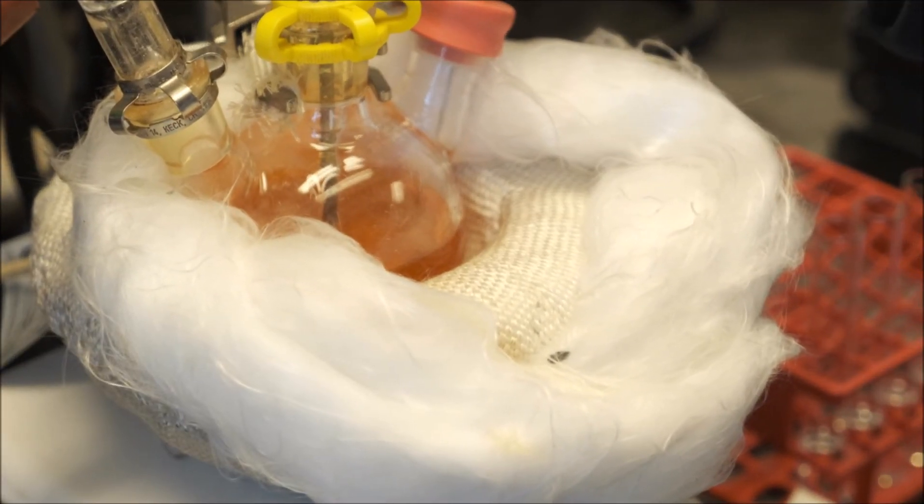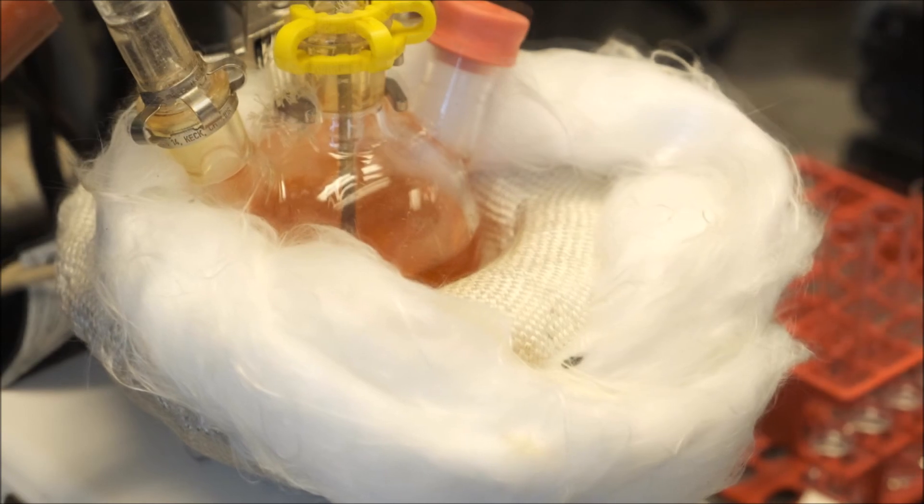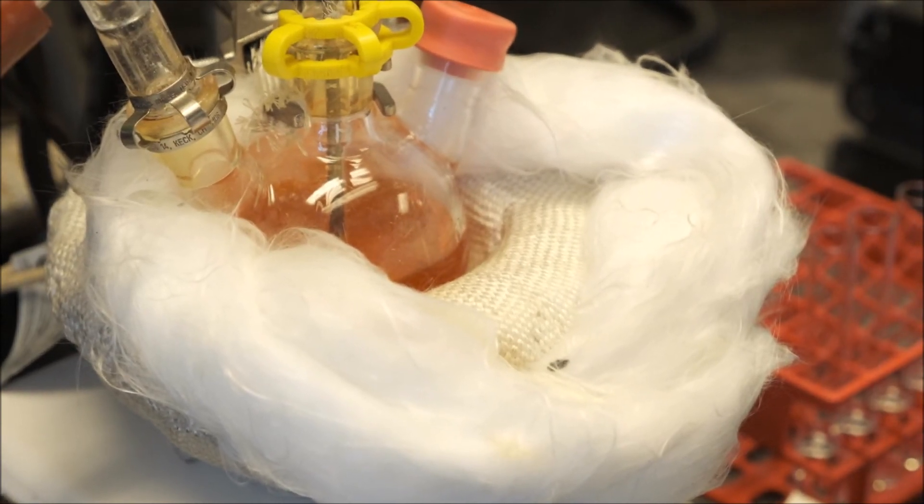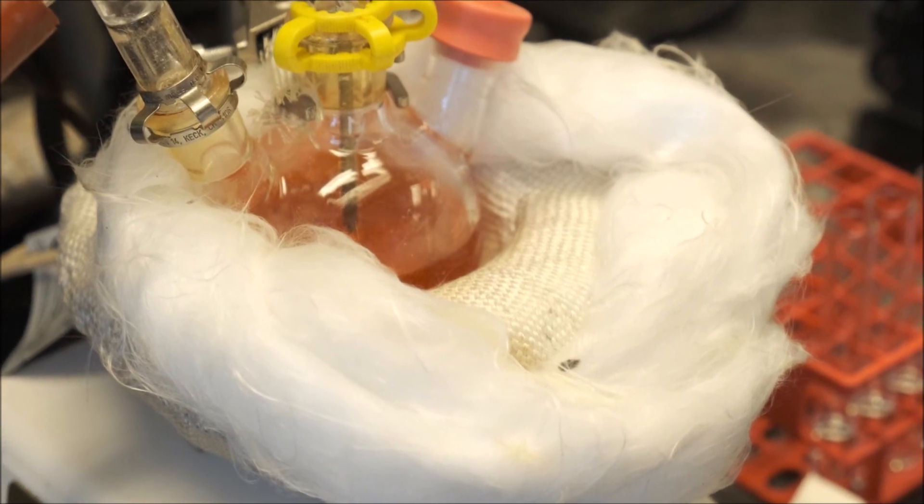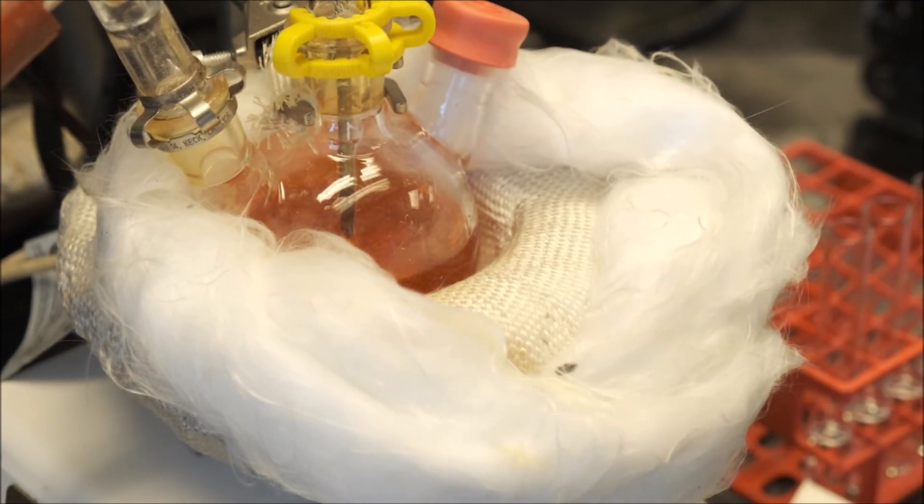When we do the hot injection, you can see there's a rapid color change from pale yellow to vivid orange. As the particles grow to larger sizes, the color of the solution evolves to deeper red.